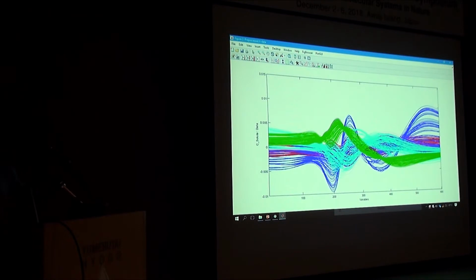But I think my aim is always to have a visual understanding of the data. And normally those are the winning solution, when the picture tells you you have something. Because you see where's the minima, where's the best solution. You know you're not there yet. You have to add to the weight there. This is really useful. You don't need to, for example, use spectral water for correction. We are still using the spectra for water as well in this correction, but we clump it together with other salts. As long as they're the same sample, we say they are the same sample.